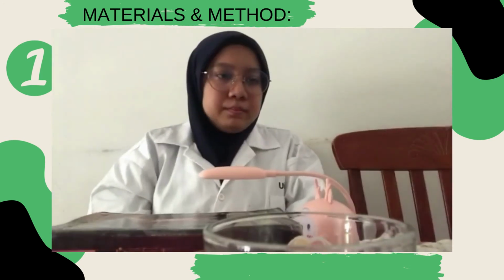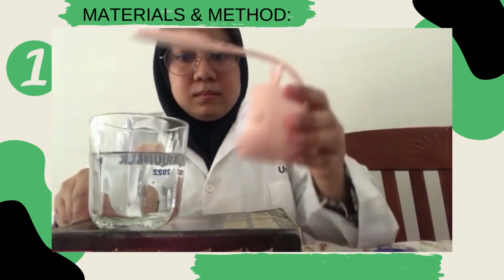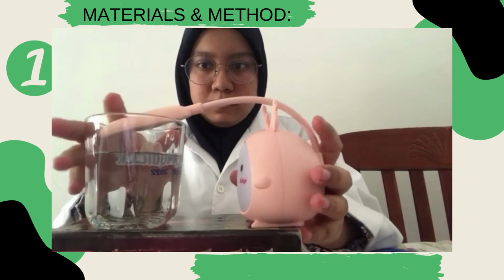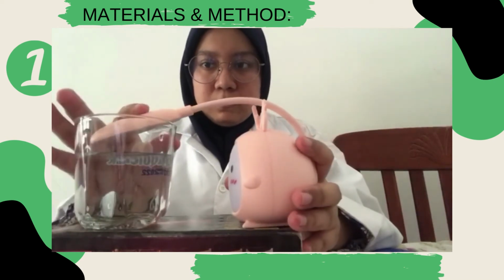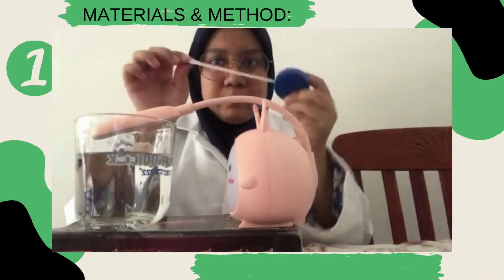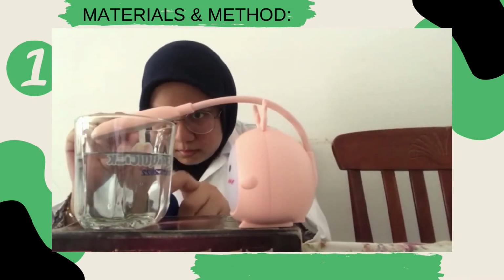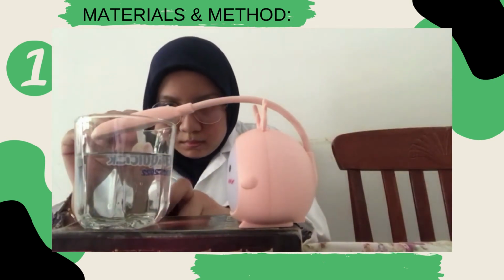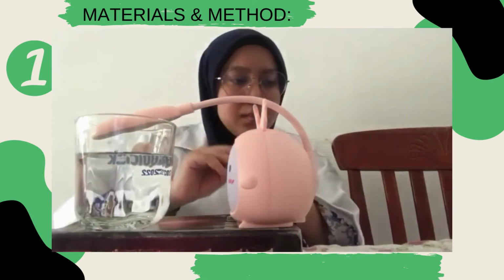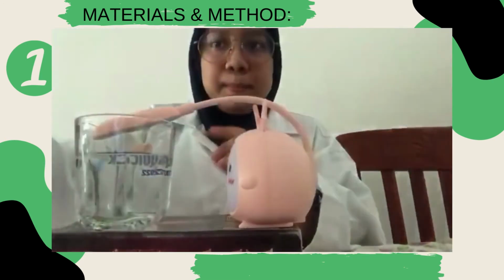Set up the table lamp so that it is suspended about 3 cm above the beaker. Turn on the light, start a timer, and watch the leaf discs at the bottom of the cup. Notice any tiny bubbles forming around the edges and bottoms of the discs. After several minutes, the discs should begin floating to the top of the solution. Record the number of floating discs every minute until all the discs are floating.